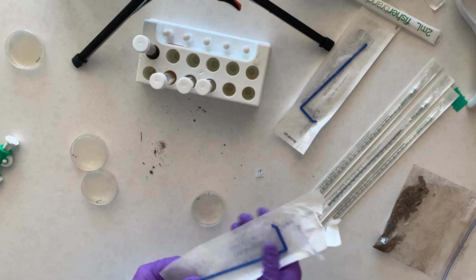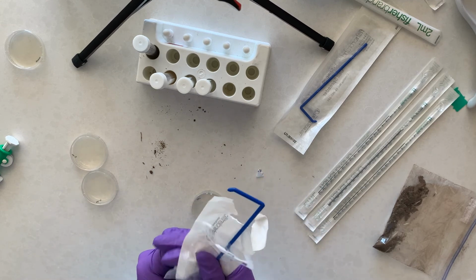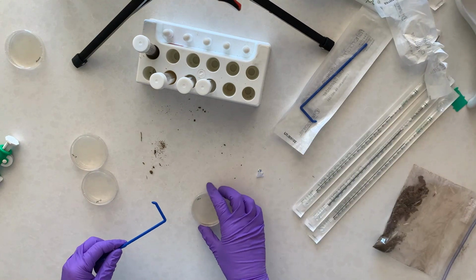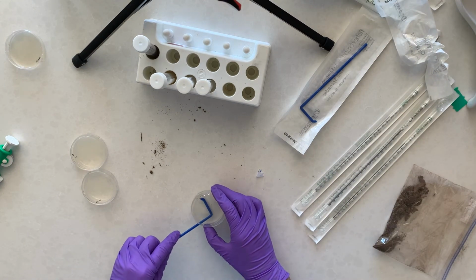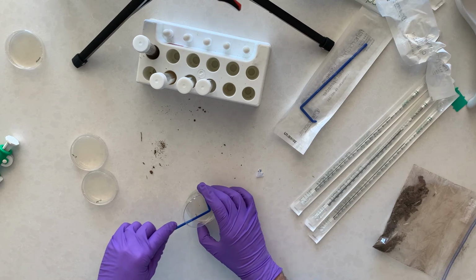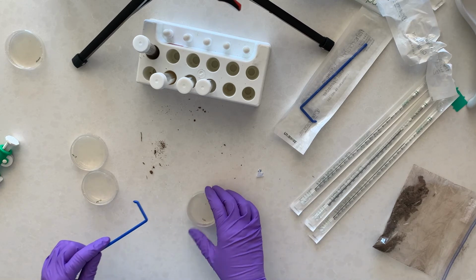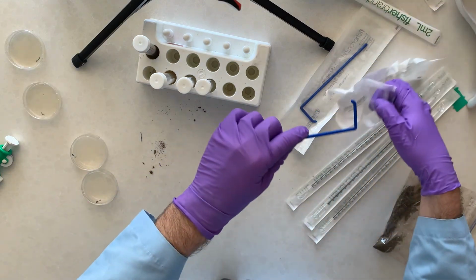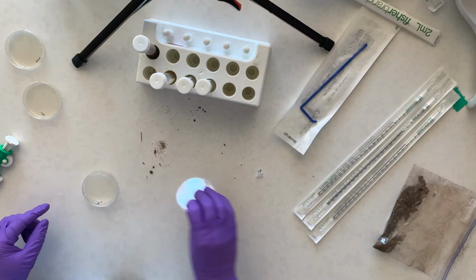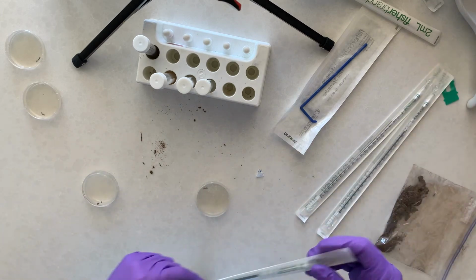Oop, I opened the wrong end, but that's all right. And repeating the process.